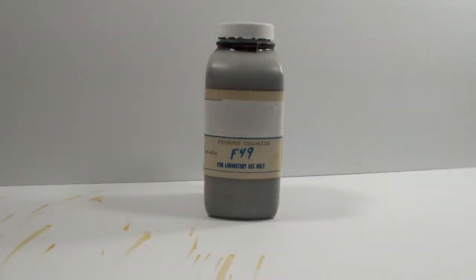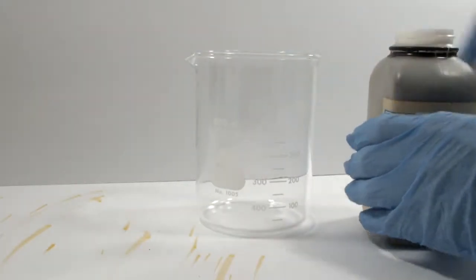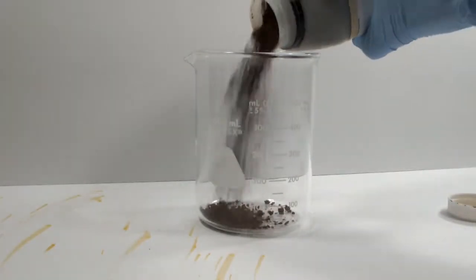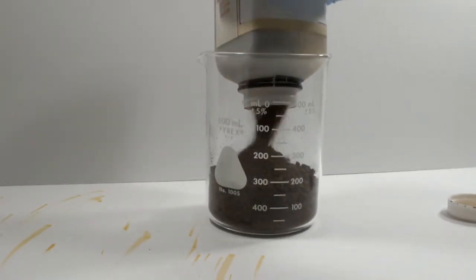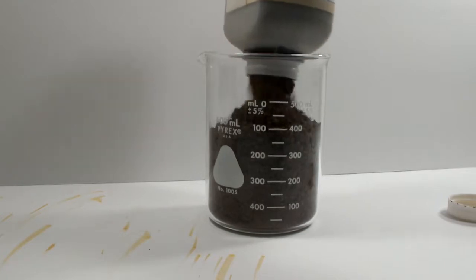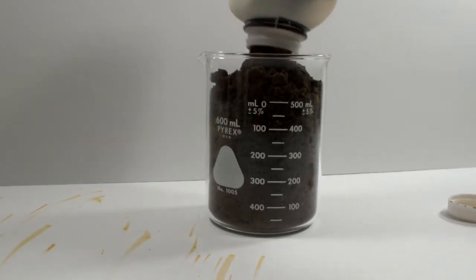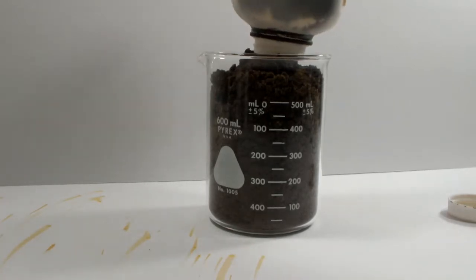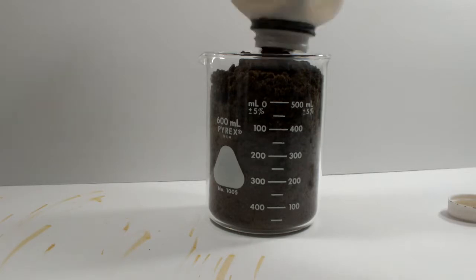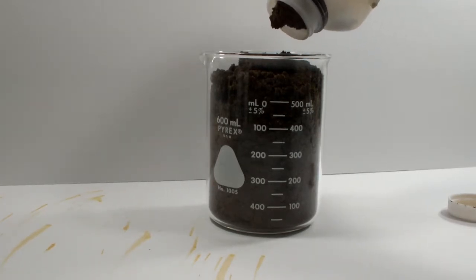Now that everything's loosened up, let's transfer it to a beaker so it's easier to deal with. Now's as good a time as any to share some more bad news. Not every chunk of this mess is hiding a big crystal like you saw in the example a minute ago. Most of this is just garbage, plain and simple. In my earlier attempts, I recovered a nice-sized crystal and left it out on an open bench for a while. It was only a week until it was completely oxidized again.